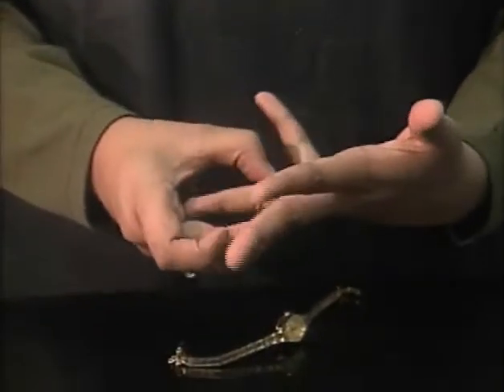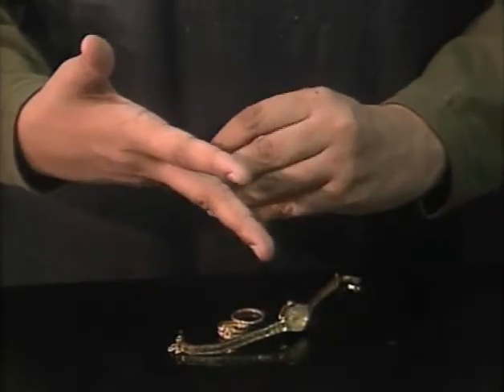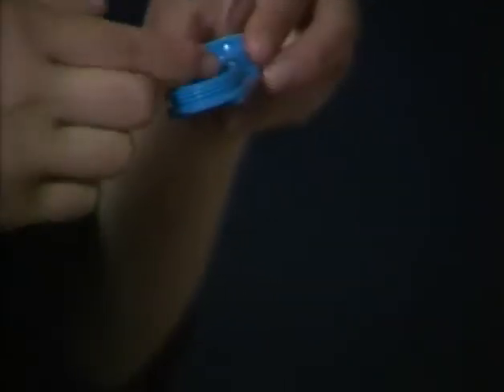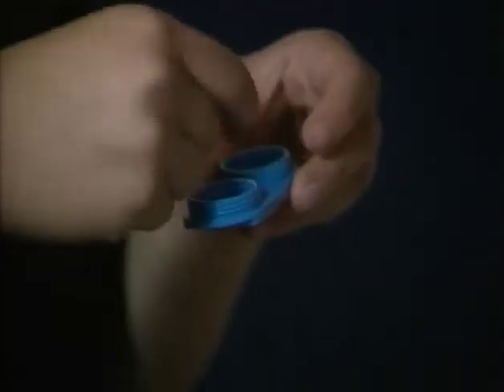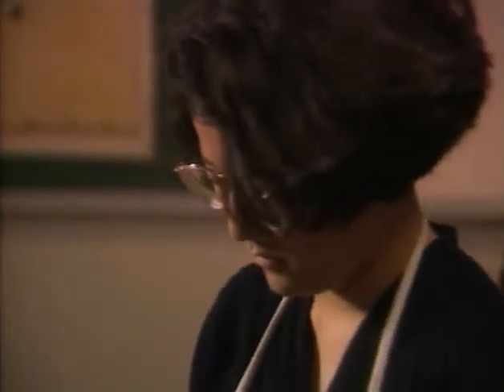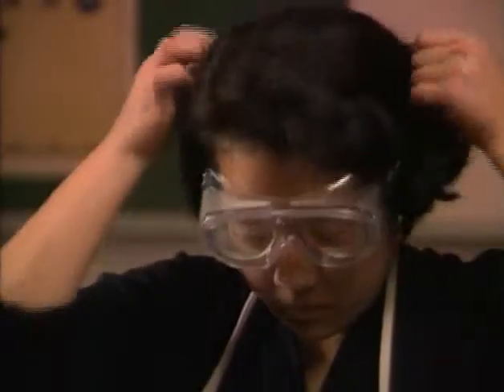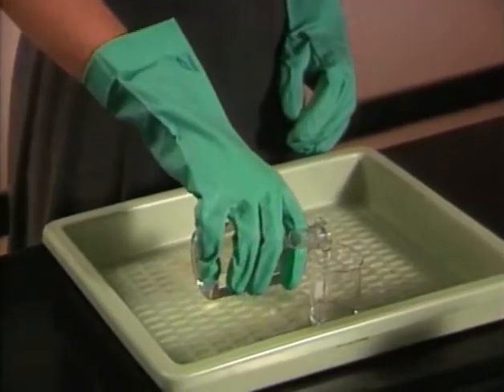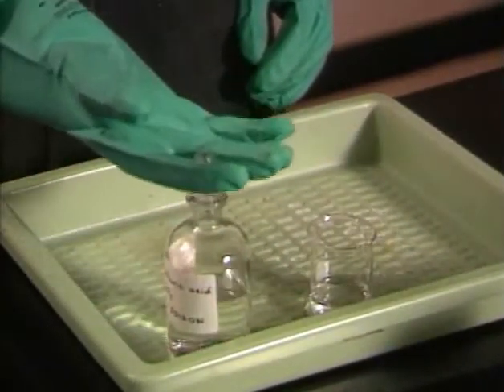Besides wearing the right clothes, there are other precautions to take. Tie up loose long hair — it could knock something over or even catch fire. Remove rings and watches, as they can trap corrosive chemicals against your skin and damage your jewelry. Your eyes are the easiest to hurt and the most important to protect. Don't wear contact lenses in lab — they may trap chemical vapors against your eyes, and your eyelids may go into spasms making it impossible to remove the lenses. Always wear goggles with side shields to completely protect your eyes, even if you're already wearing glasses. Never use bare hands with concentrated acids, bases, or other reactive chemicals — your teacher will tell you what type of gloves to wear.